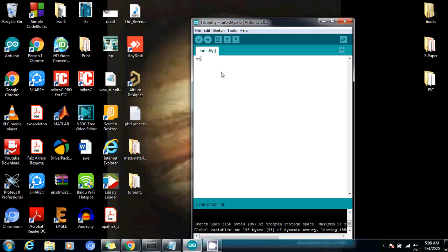So first of all, as you know, we need to write the void setup and to initialize the baud rate we write Serial.begin. We are going to use a 9600 baud rate, let me just write it in the comment section, baud rate. And now let's write the main program here in the void loop.